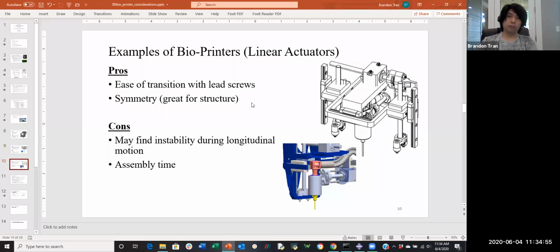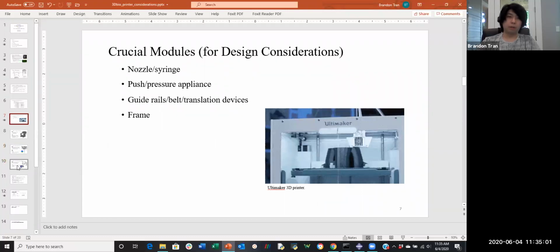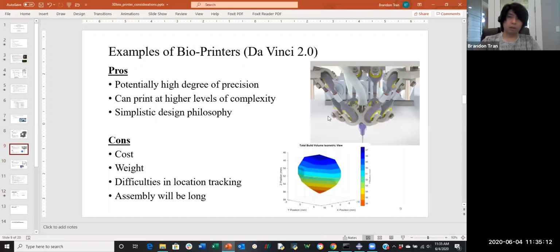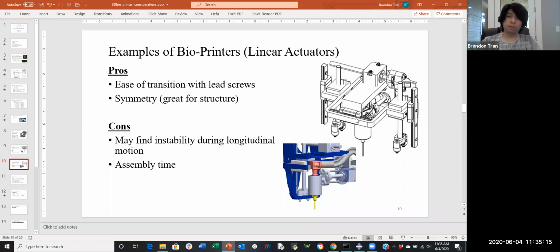Last thing is linear actuators. Linear actuators are probably the most common. That's basically what the Ultimaker is following right now, which is a system of lead screws connected to servos that guide you to somewhat precise locations, not as precise as the previous device, but nice, consistent, robust, and overall generally more accepted because of how easy it is to design or work with. It has great symmetry. That symmetry is absolutely fantastic for structure. If you guys are in the failures and design group, you kind of want to try and get things to be as symmetric as possible.